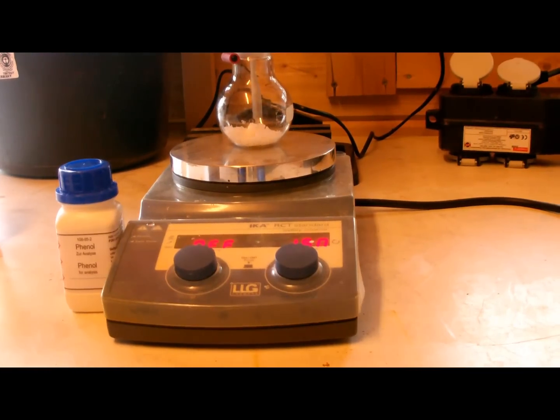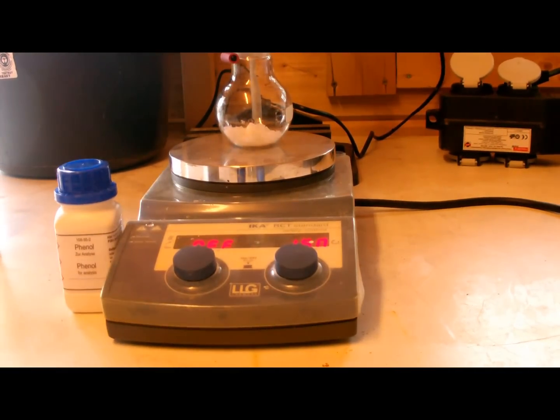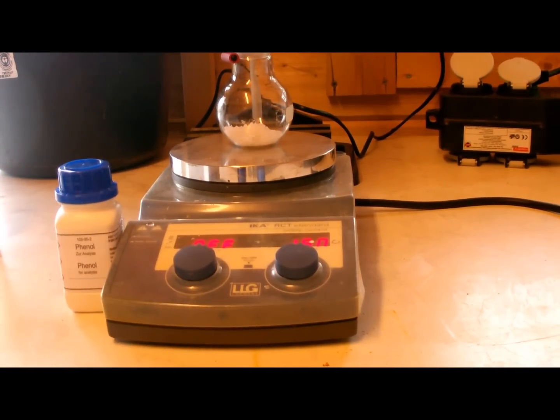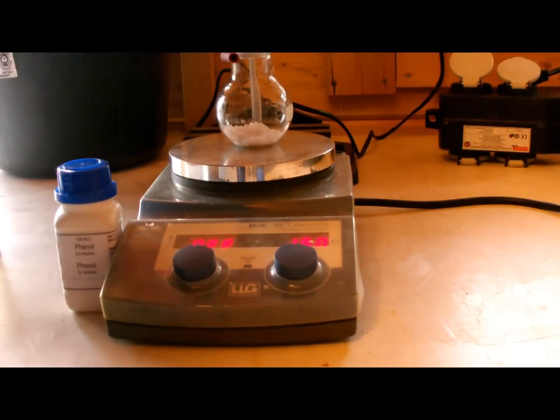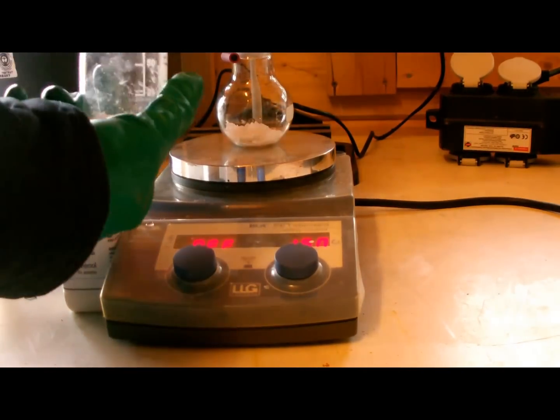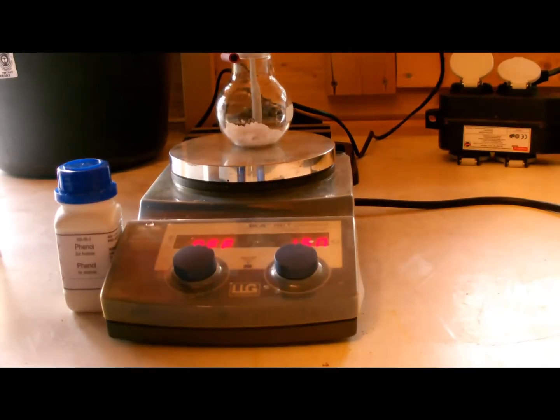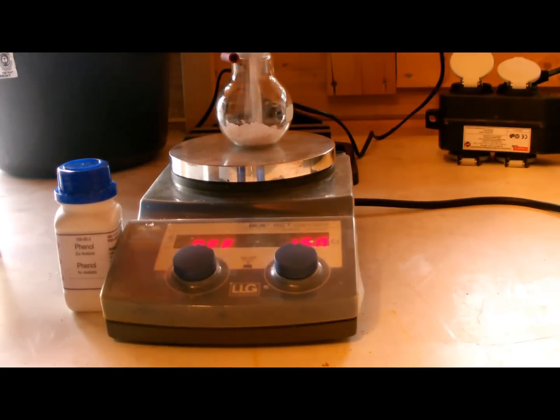Hello and welcome to one of my new videos. Today I want to show you how to synthesize phenolphthalein. Phenolphthalein is commonly used in the lab as an indicator in acid-base titrations.